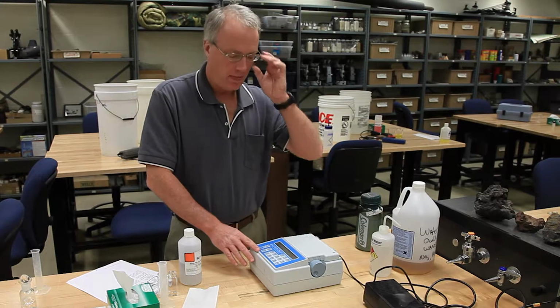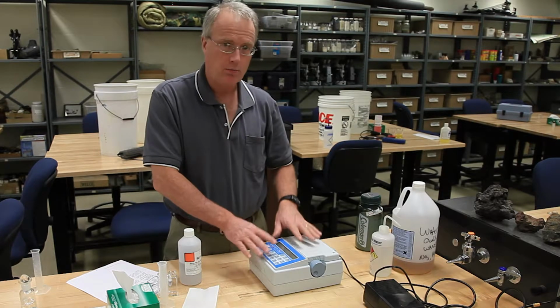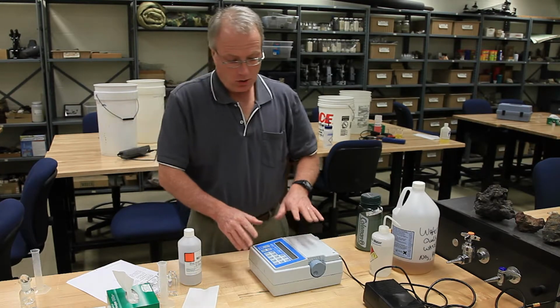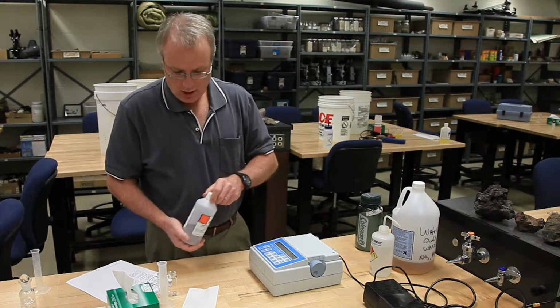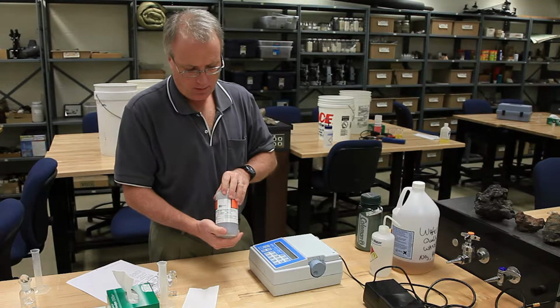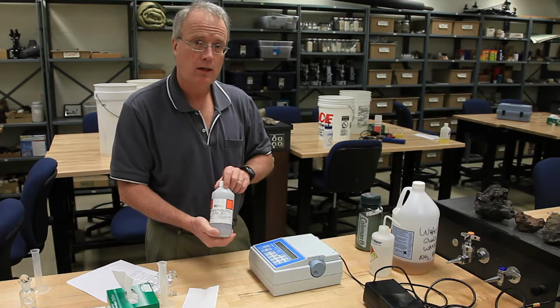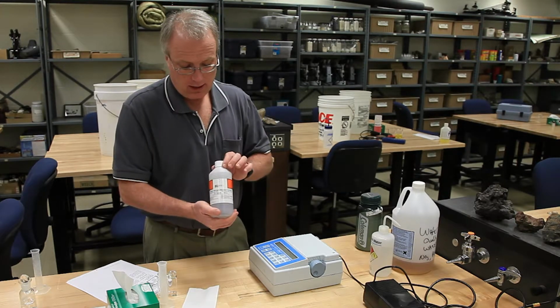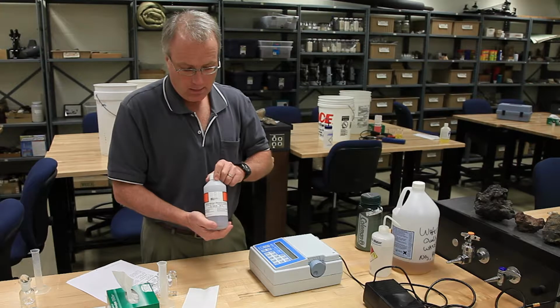Okay, I want to talk a little bit about the quality control steps when you're using the spectrophotometers to measure nutrients. The quality control step, as you know, is the step we use to make sure this meter is working properly before we use it to take a measurement of an unknown water sample. So the quality control step with both the phosphorus and the nitrogen test is to run the procedures on a standard. This is purchased from the company, and we know exactly how much nitrate is in this standard. And of course we also have a standard for phosphate. The correct amount that is actually in here is 1.0 milligrams per liter for both the phosphate and the nitrate, 1.0 milligrams per liter.